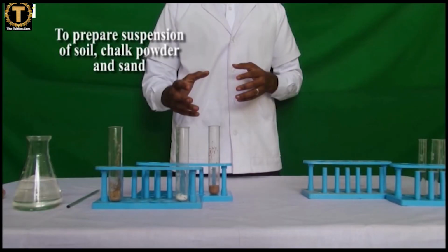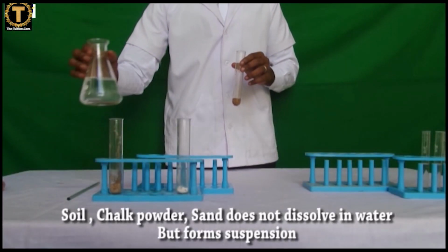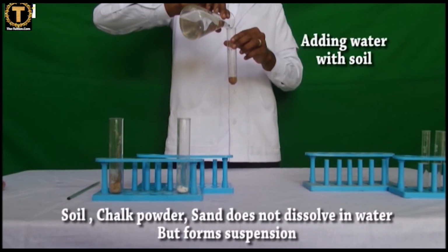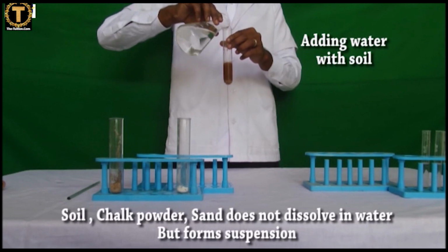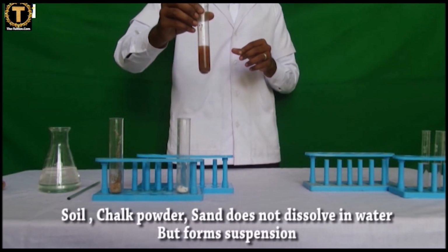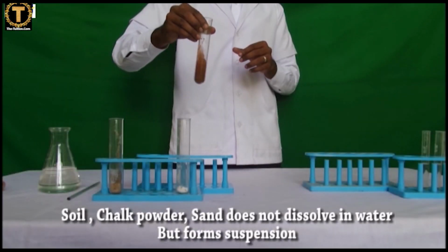B. To prepare a suspension of soil, chalk powder and sand in water. Suspension of soil in water. Take 2 to 5 ml of distilled water, add half a pinch of garden soil, stir well, keep the test tube on the stand, record your observation.